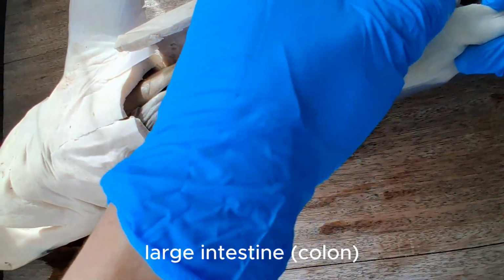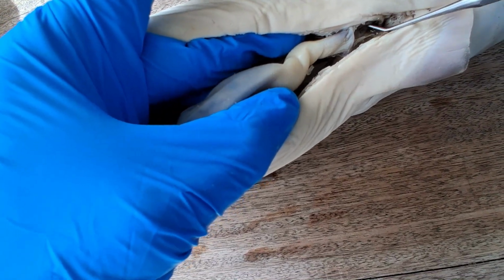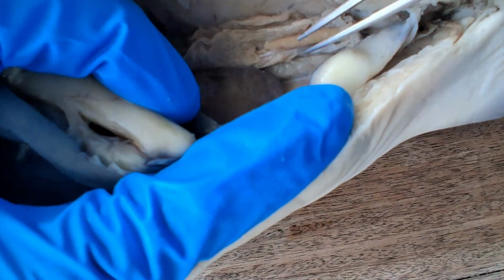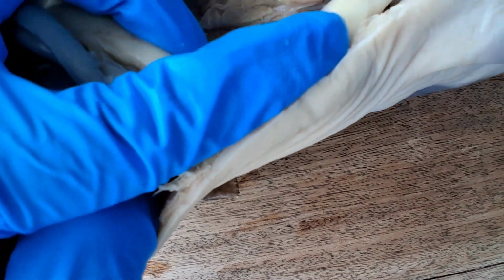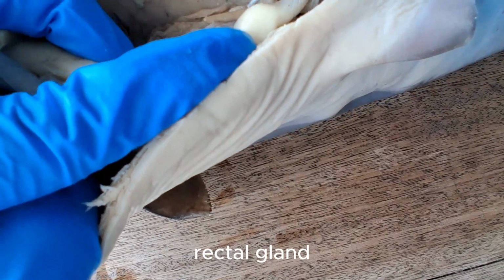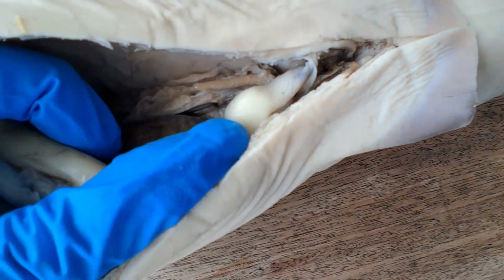And there's a short large intestine here leading to the cloaca, which is a common chamber for feces, urine, and sperm. So you see this finger-like organ here connected to the large intestine. That's the rectal gland of the shark. Only sharks have them. Rectal gland or digitiform gland.